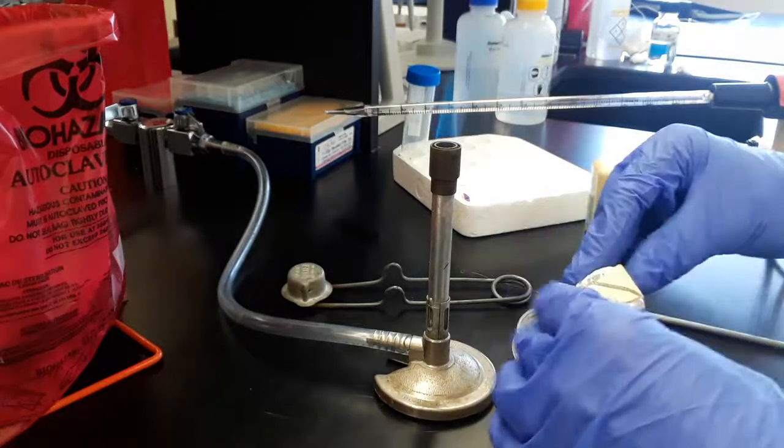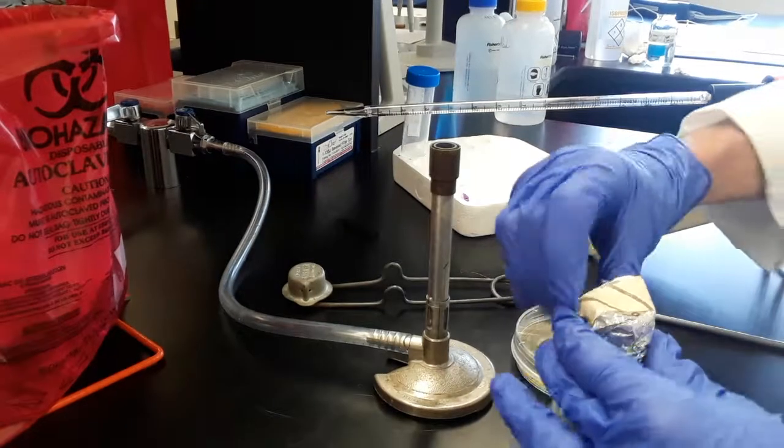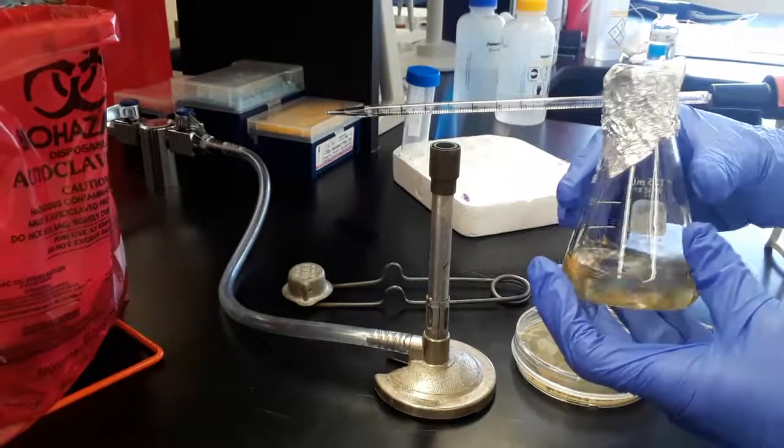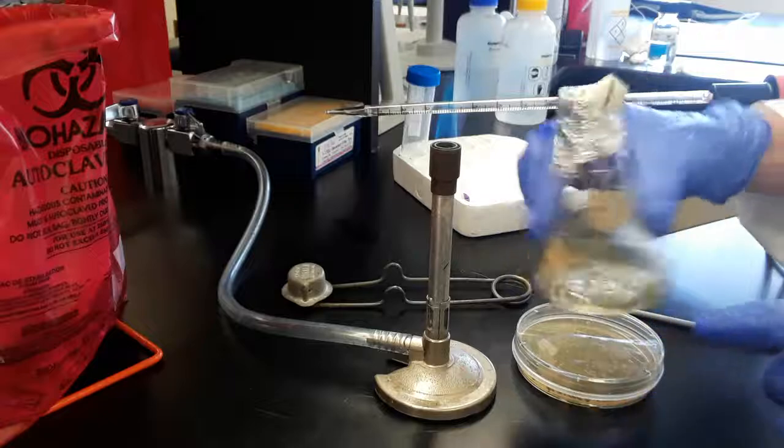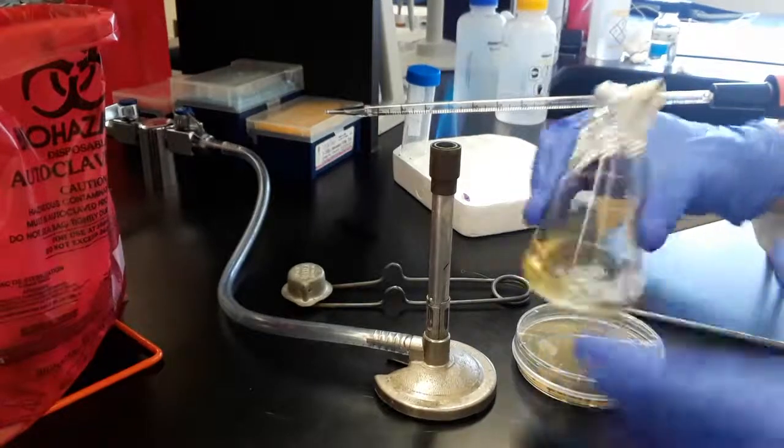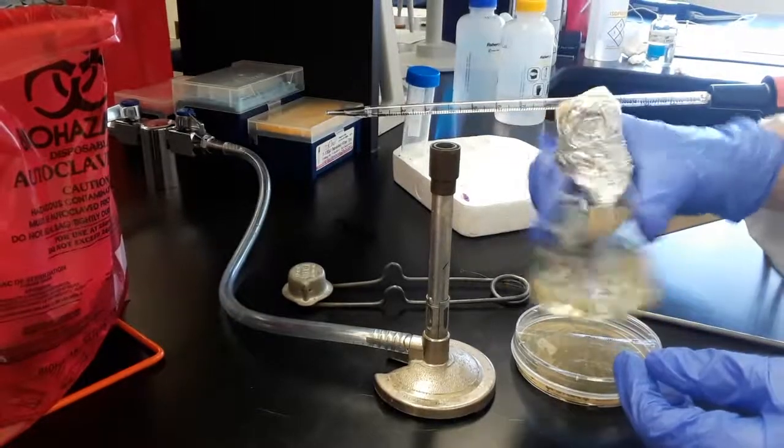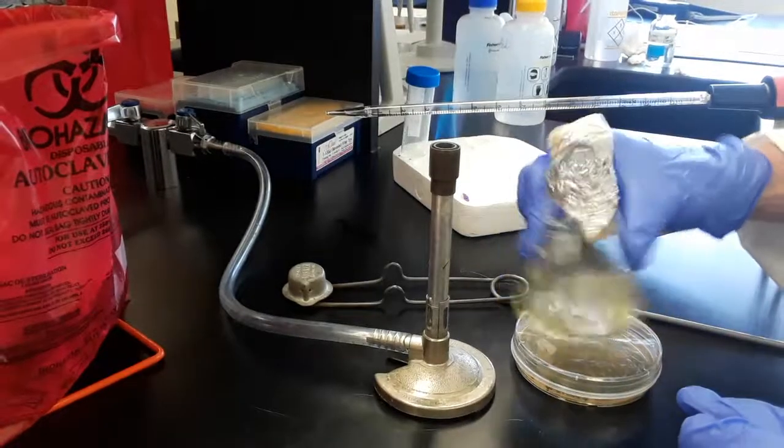The DNA plasmid construct that we've engineered and put into this bacteria stays in the bacteria only if there's ampicillin antibiotic in the media. The resistance to ampicillin is on the plasmid, and that makes sure the bacteria will maintain it.